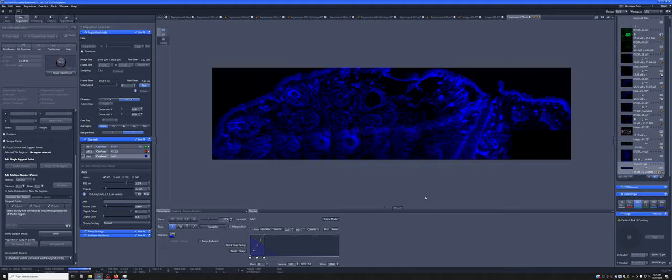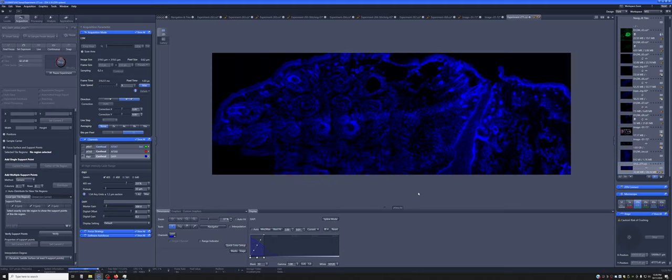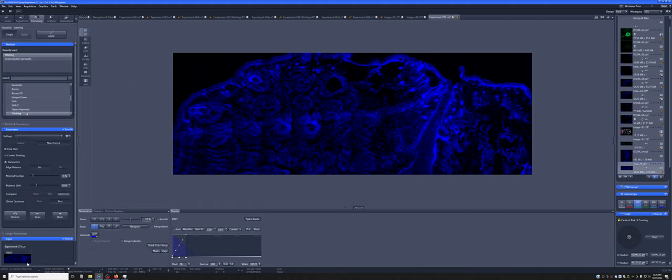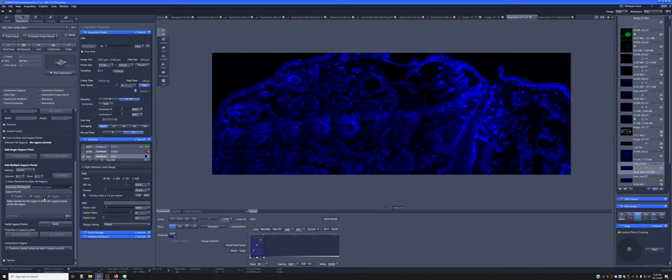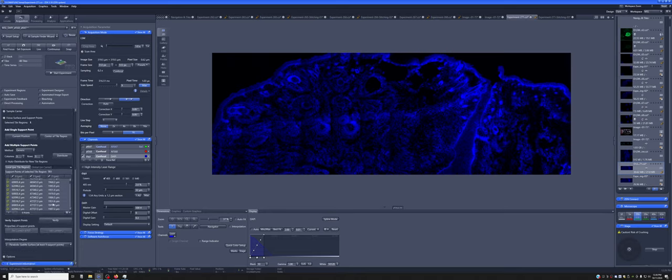So this can be a really useful strategy if you're stuck with a slide where the tissue is uneven. This can allow you to compensate for that during the imaging. And just like any other, you can go ahead and stitch it here to fuse the tiles together. You can see it's not perfect. There are some artifacts, but it's way better than if you tried to do it without any kind of support surface.